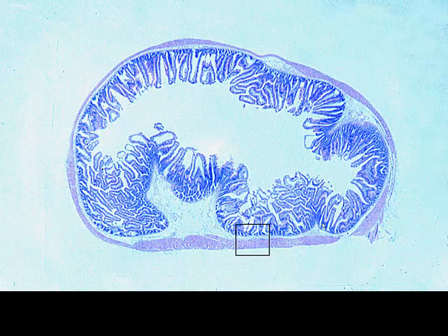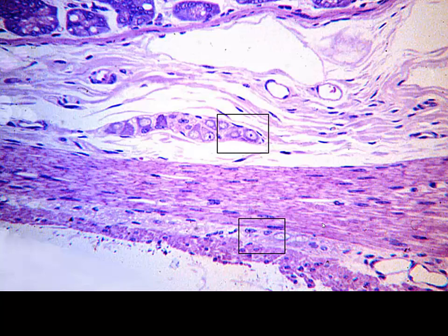Now, in the intestinal tract, we're also going to have bundles of nerve cell bodies, ganglia. They're going to be present in two different locations. We're not going to worry about those. We'll cover those when we get to the alimentary canal. But again, when we look at them in histological preparations, we're going to be able to recognize them as our clearly visible nucleus, prominent nucleolus. And we're going to know that these bundled together masses are going to be our ganglia.